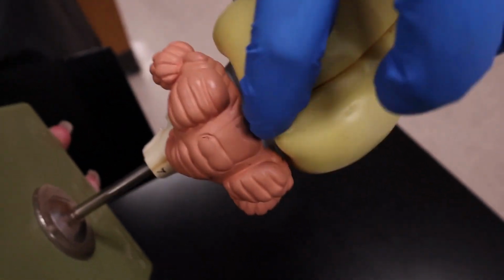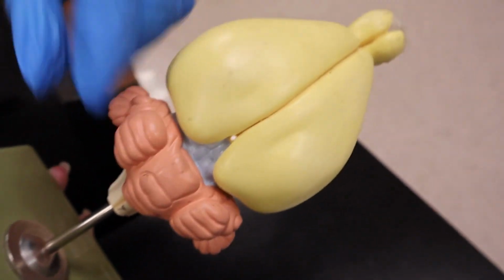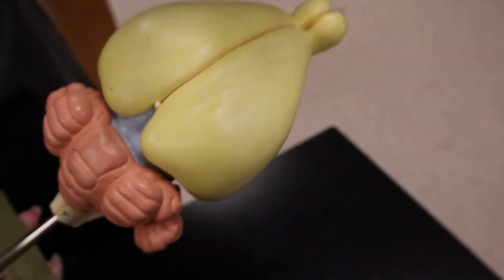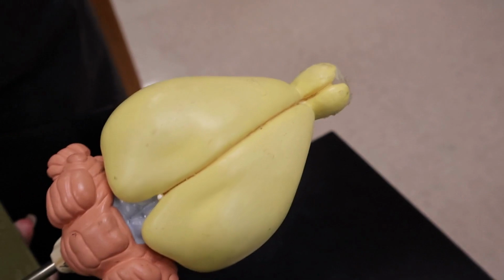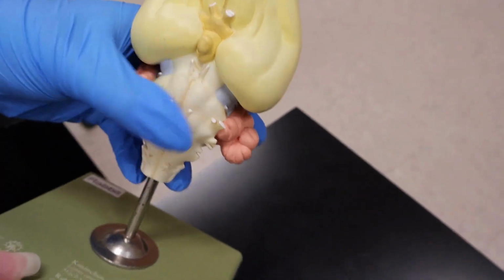Okay, so then we have the blue that's going to be right here. This is going to be the midbrain. It's going to be inside right next to the cerebellum. So this is going to be the midbrain or the optic lobes. This is essential for the optic lobes, which enable sight. So it's going to be right here, the midbrain. You can see on the side right there. It's going to be in front of our medulla oblongata.